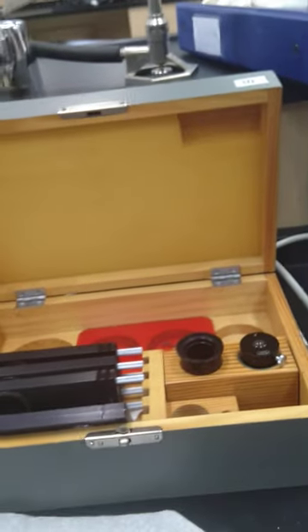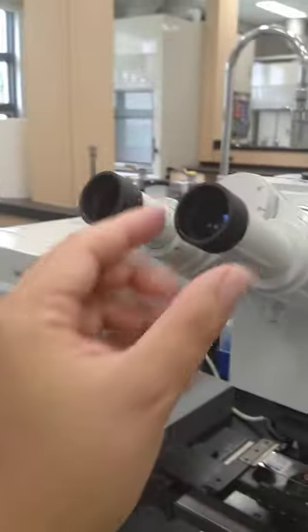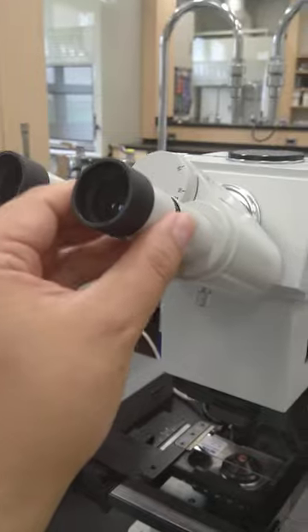For this part, you have to be very careful. We go here and just pull this out.